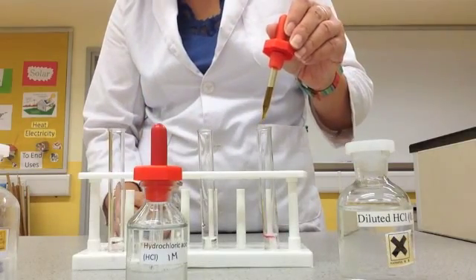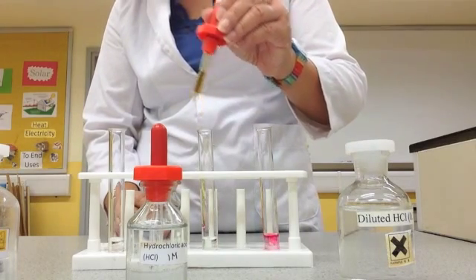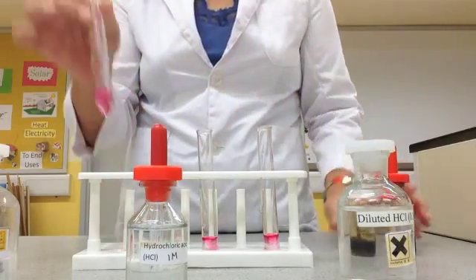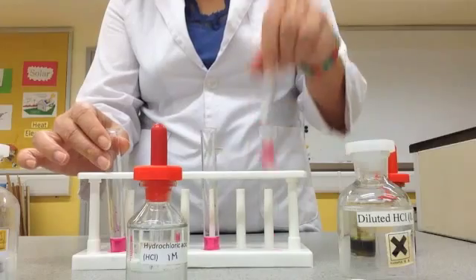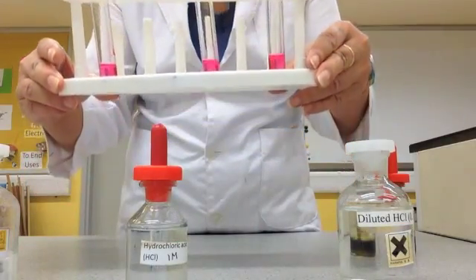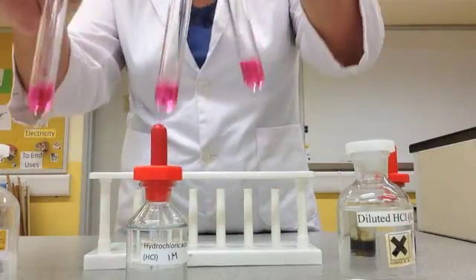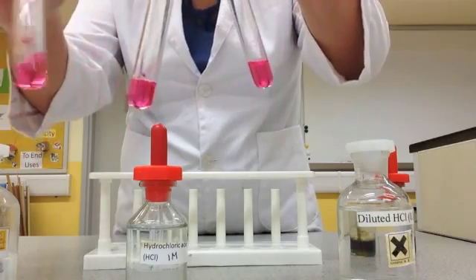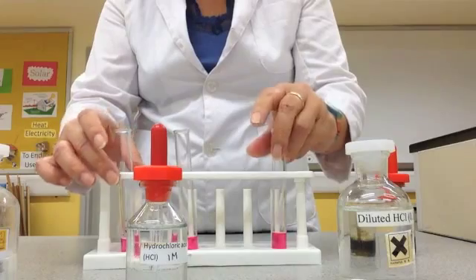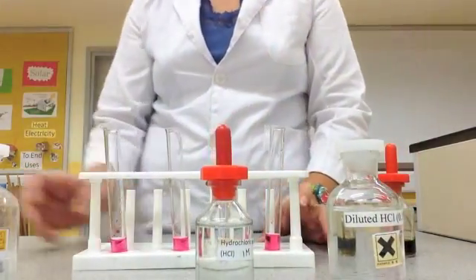I'm going to put some universal indicator — 2 drops in each. Now let me shake it. What do you see? All three have the same color, whether it's 0.1, 1, or 2 moles. They are the same strength, same pH value. So now let's see the difference.